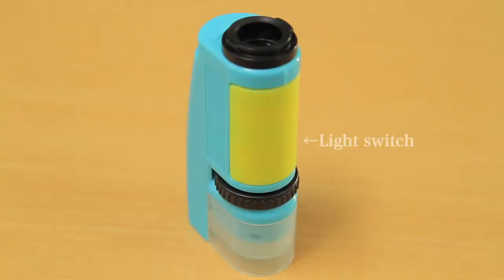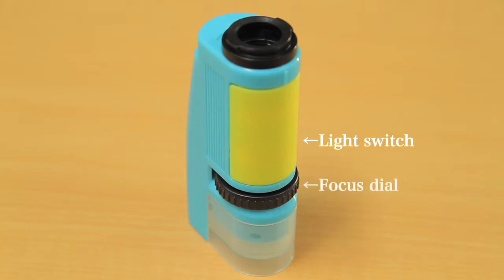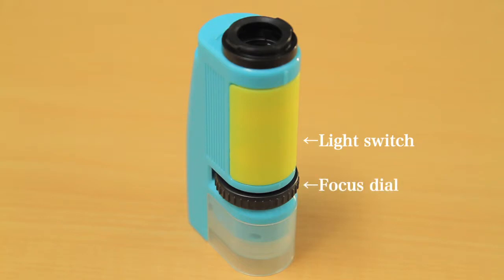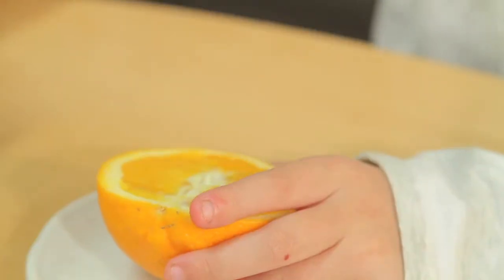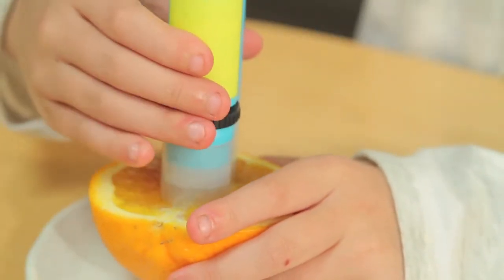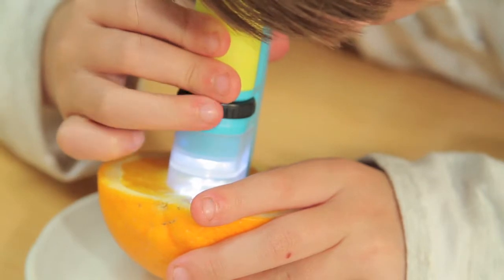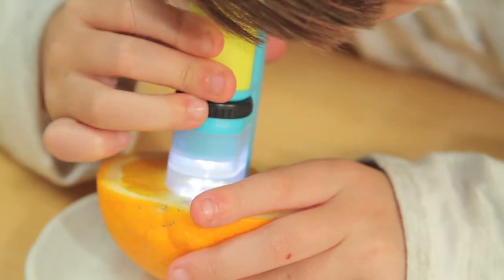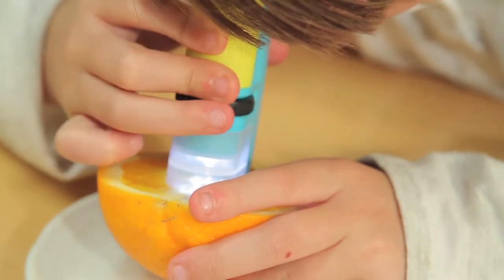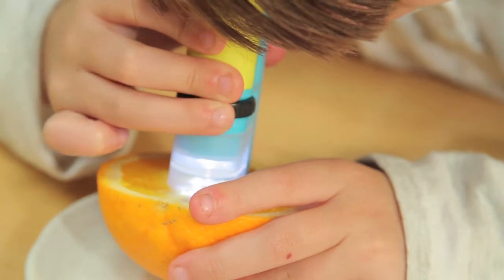Push the light switch to turn on the light. The focus dial brings images into focus. Put the light cover directly on the item you want to view. Place your eye close to the lens while pressing the light switch. Turn the focus dial left or right to adjust the focus.